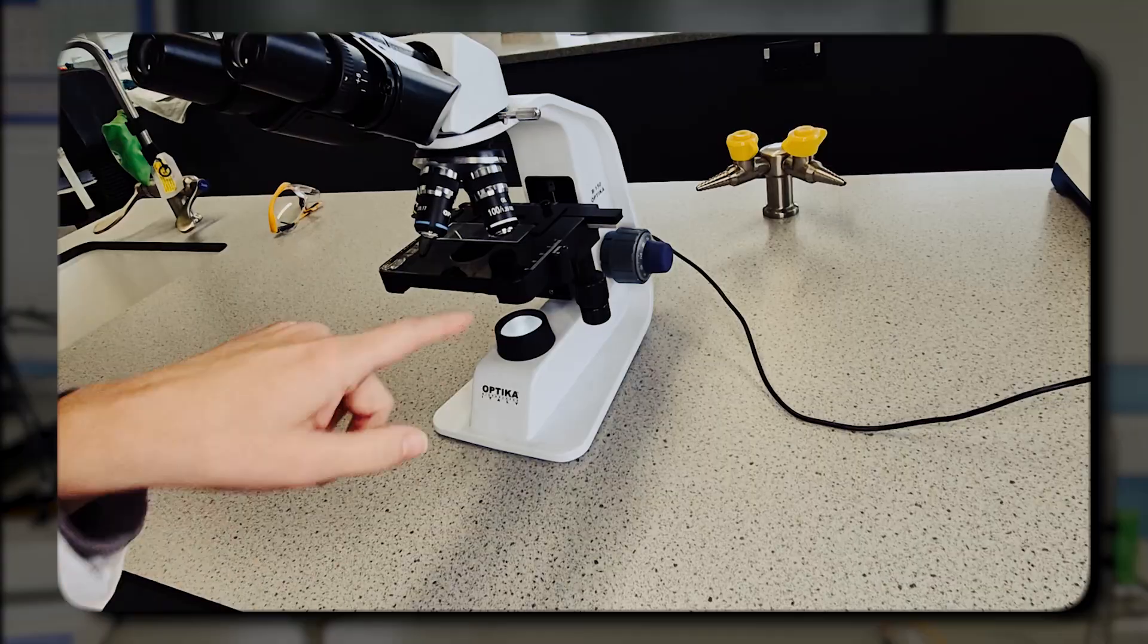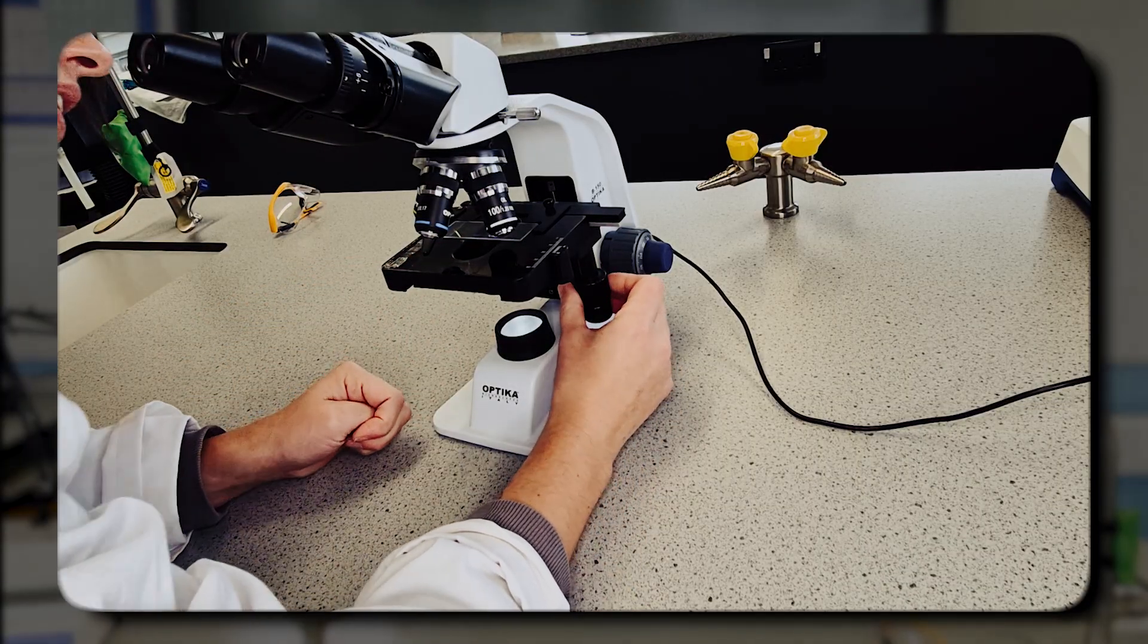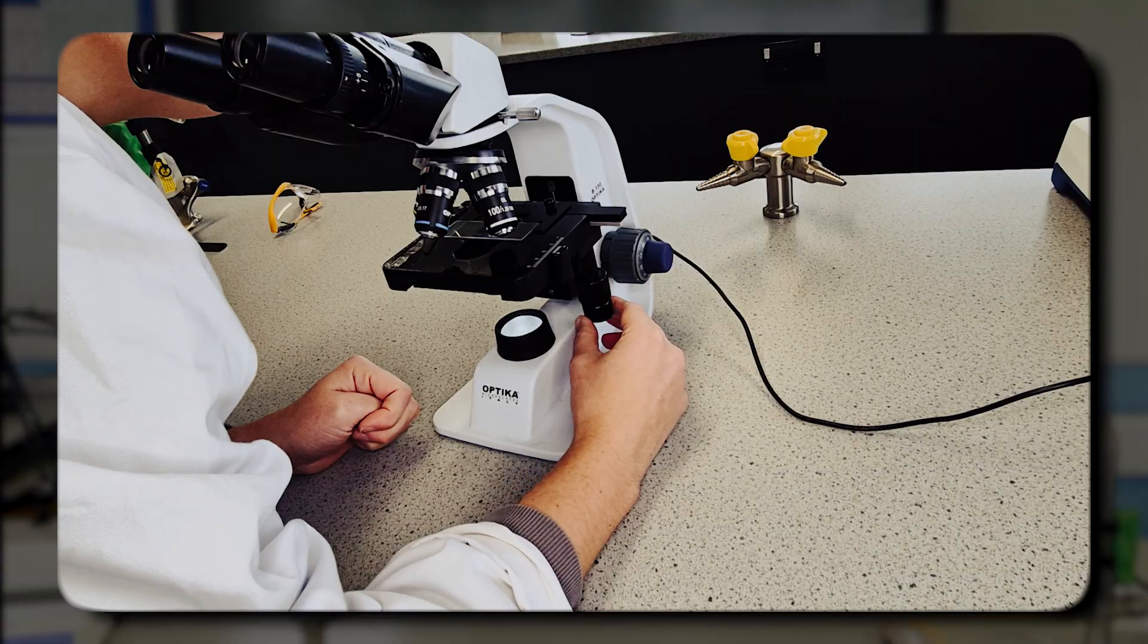I've actually got a dial here that I can turn to move my specimen so I can see it's directly under the light. So I know it's going to be in the correct position.